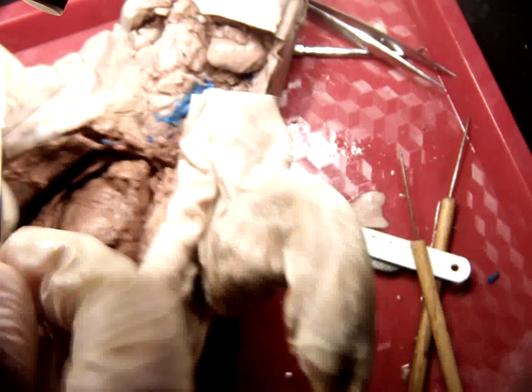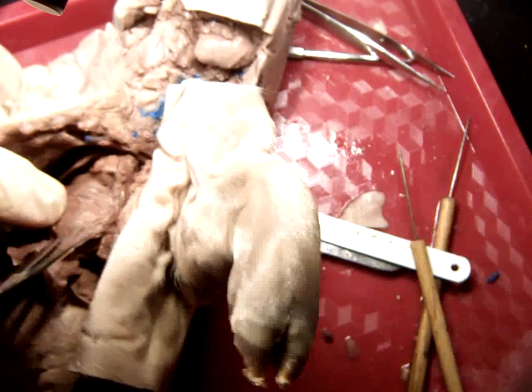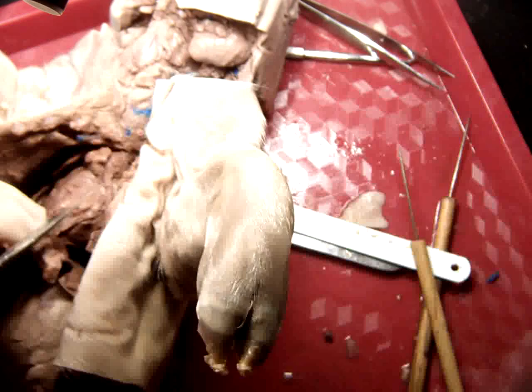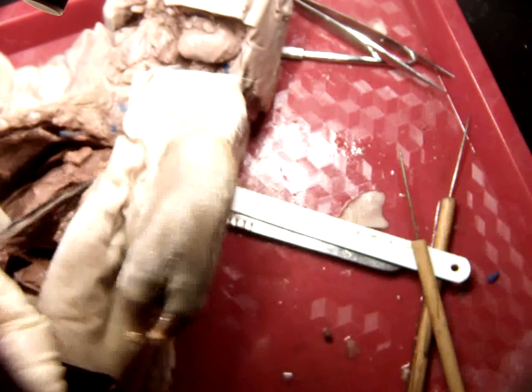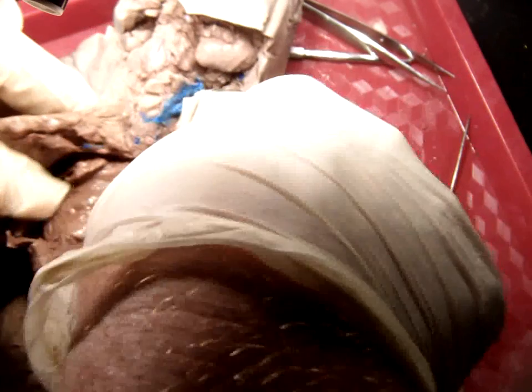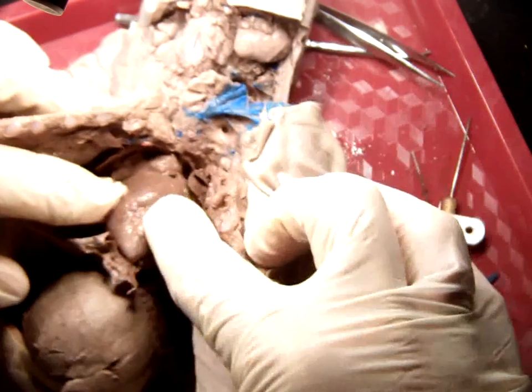Then right here in the center is the heart. Now, I am going to take back what I said, I'm going to make one cut here, because the heart sits in this bag. Remember I said everything or nearly everything in the body is surrounded by this saran wrap-like material called peritoneum. Around the heart, the peritoneum's name is pericardium because it's named after the heart itself. So this right here is the heart, right in the center of the chest.